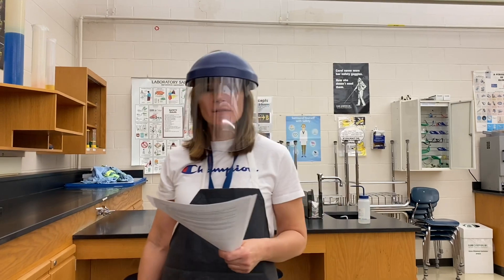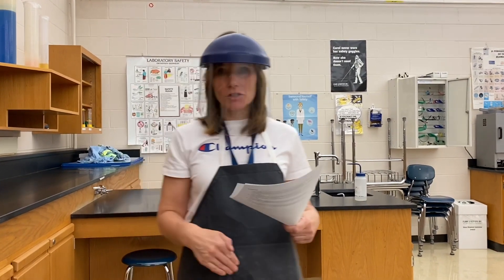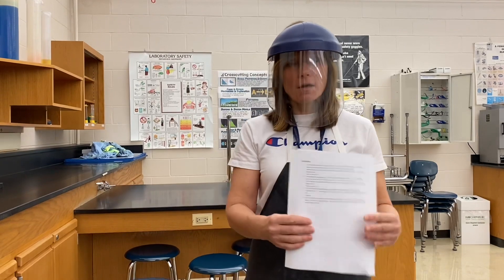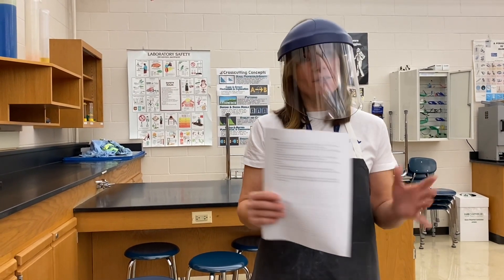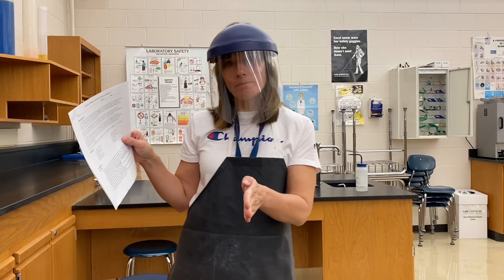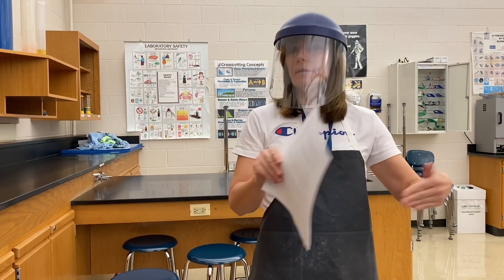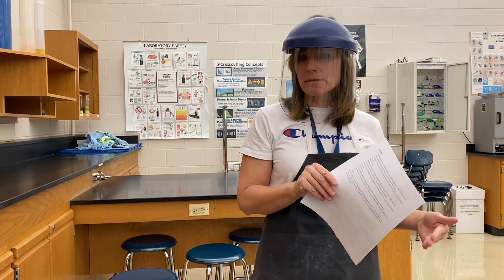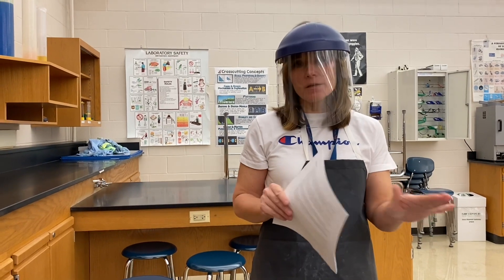The title of this lab, which was posted in Google Classroom, is called Reaction of Sodium Carbonate and Calcium Chloride. You can read the introduction, where it talks about the Law of Conservation of Mass, which says that everything you start with has to be accounted for in your products. The atoms are all there — they just rearrange themselves.